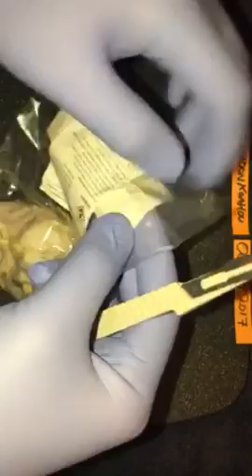I might have to make a small incision into the bag though. Sometimes it's hard to open up. For this I'm gonna use my old scalpel — see, it comes in handy. Let's make a tiny little incision there. This video is not going well, however it's already begun. I have gloves on and I can't stop recording. It is my hope that you'll just completely ignore the first part of this video. There's the brain.